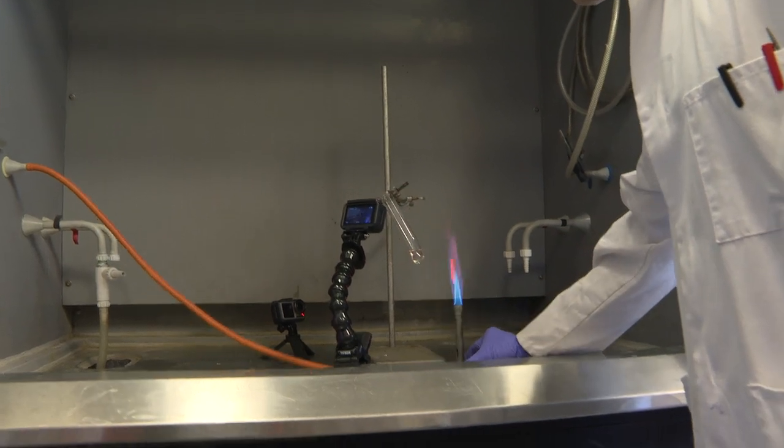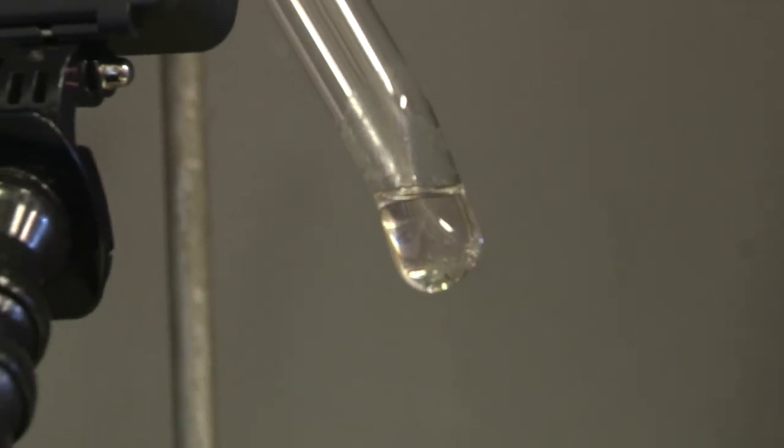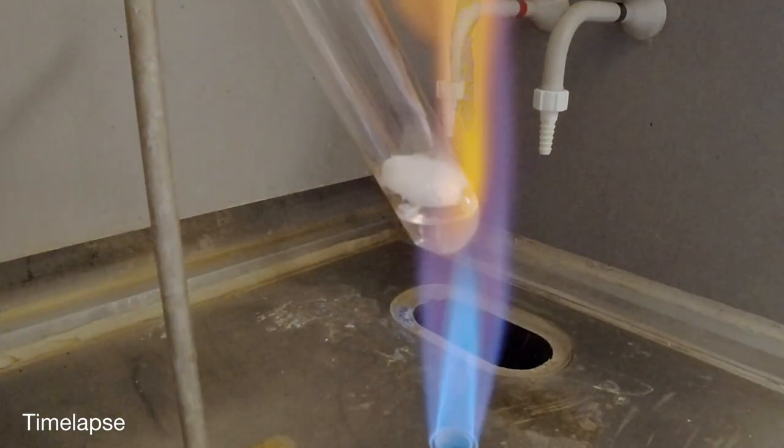And the test tube, which was straight, began to bend. Fortunately, glass does not have a precise melting point, so it still was intact.